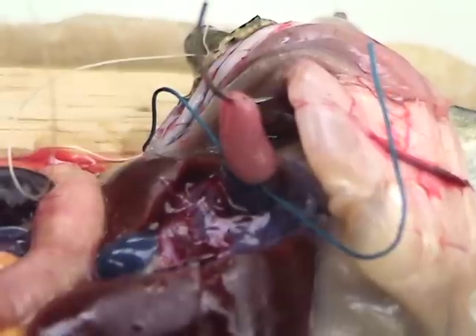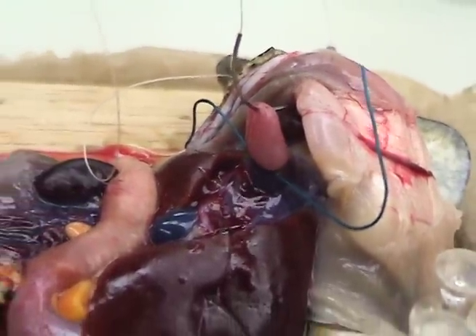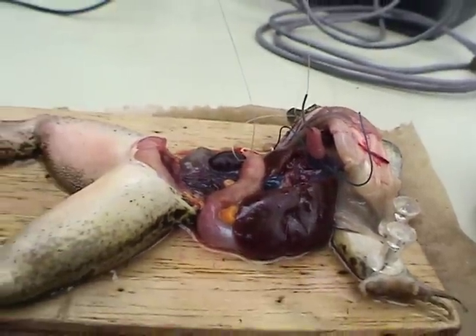So it's just beating off of reflex, the ventricle? No, it's beating off stimulation from the sympathetic nervous system. Because it doesn't even look like there's blood in there. But you know, that's a bad sign.